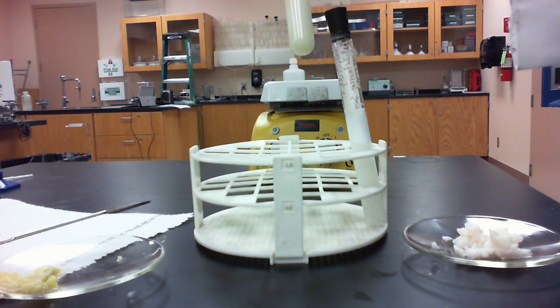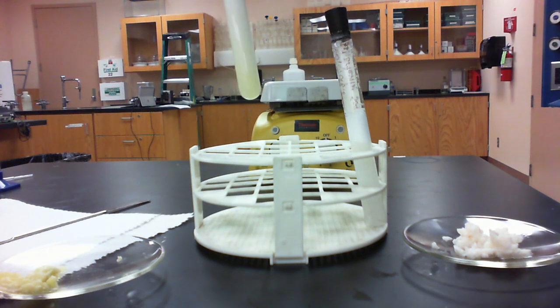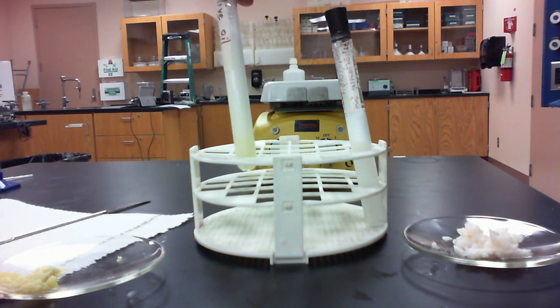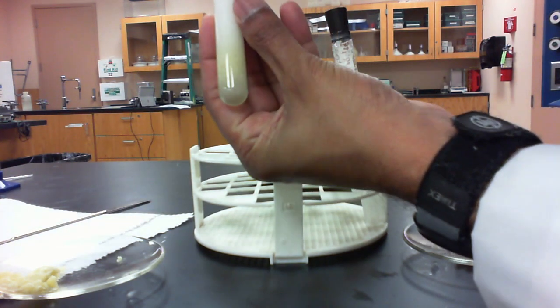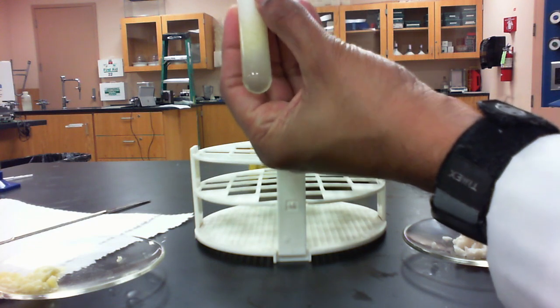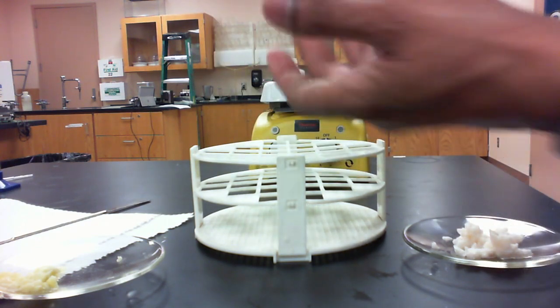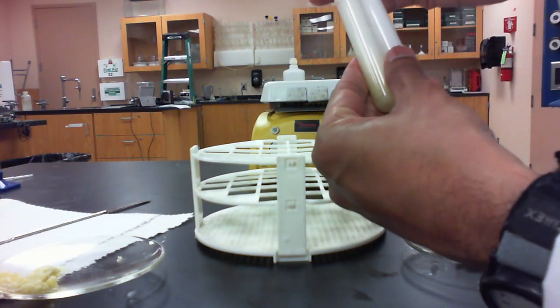And just a reminder, when you have to shake your tubes, you don't use your thumb as a stopper, you actually use a stopper itself, so you avoid any exposure to the chemicals. So we can make a comparison here. The olive oil soap is on the left side, the vegetable oil soap there on the right. I'm sorry, the vegetable shortening soap is on the right side.